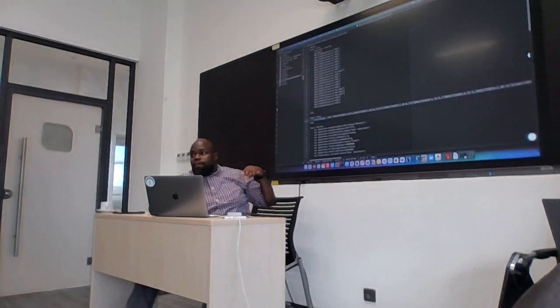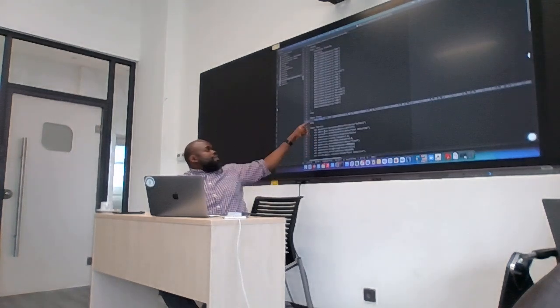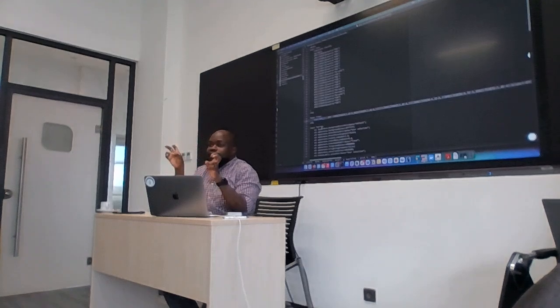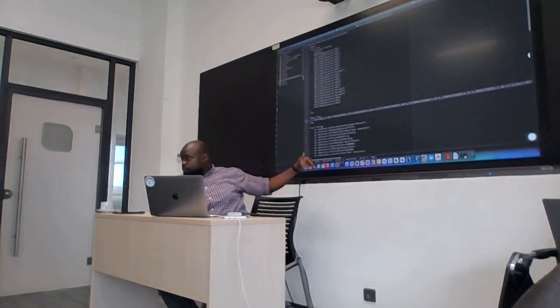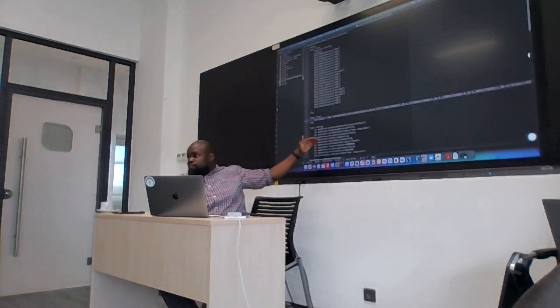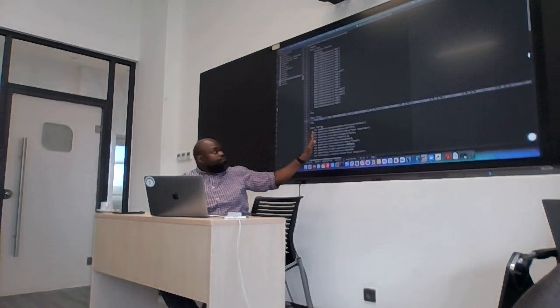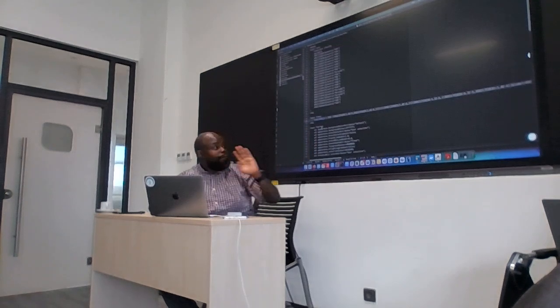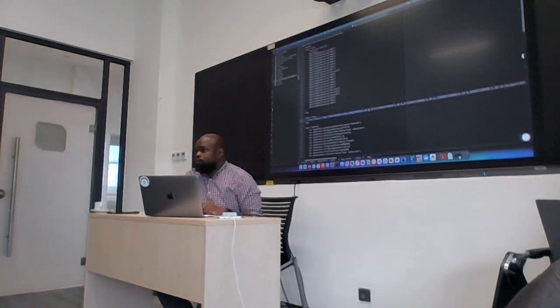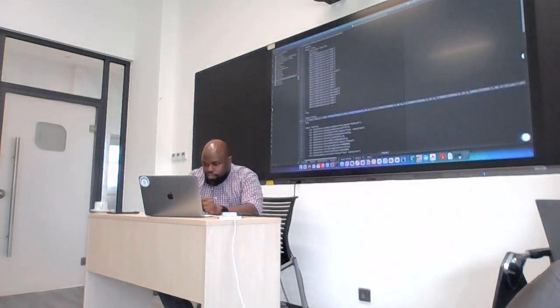Okay? Then for this one, at the bottom here, because we are using FigTree and it has its settings, it has also added a section at the bottom. So don't always expect this will happen. This is specific to FigTree. Is that okay? Do you see the difference now? But you can see that this section for the tree should be the same as the old one.